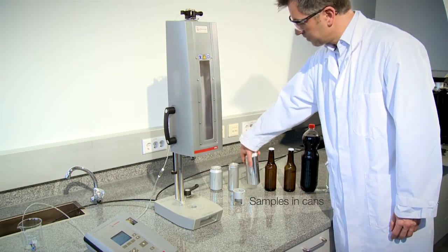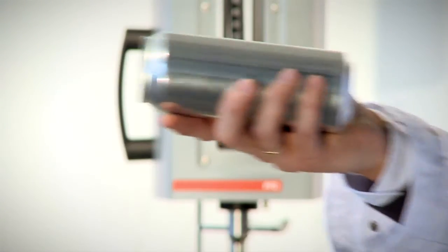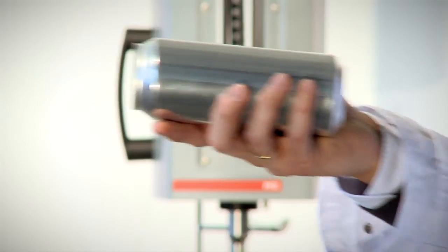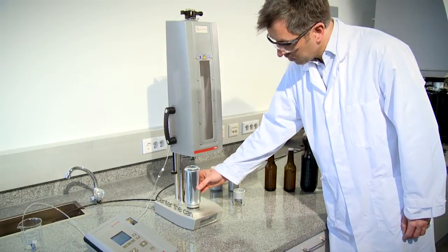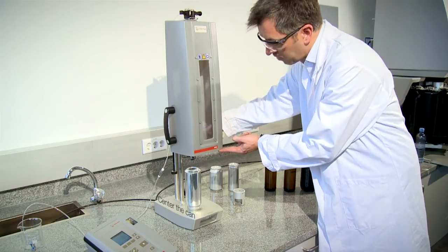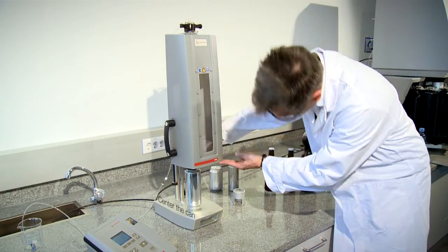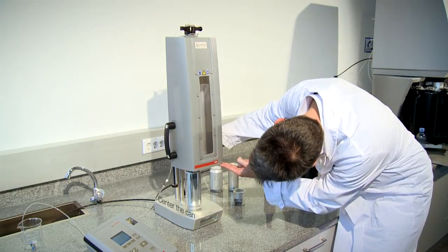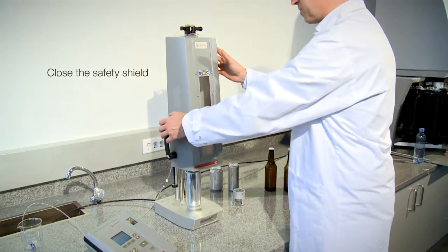When working with a different container, such as a can, you can adjust the height of the PFD piercing head. Center the can, adjust the piercing head, and close the safety shield.